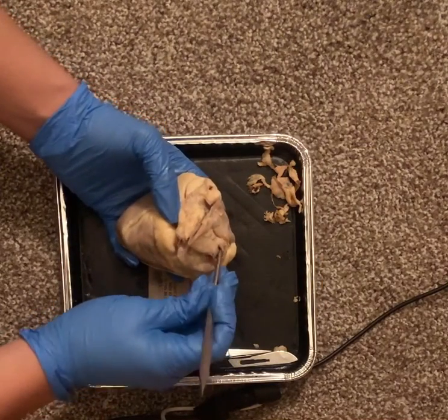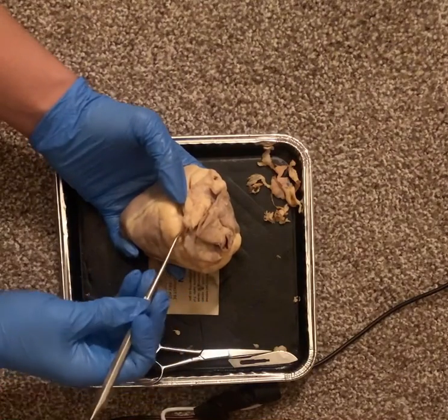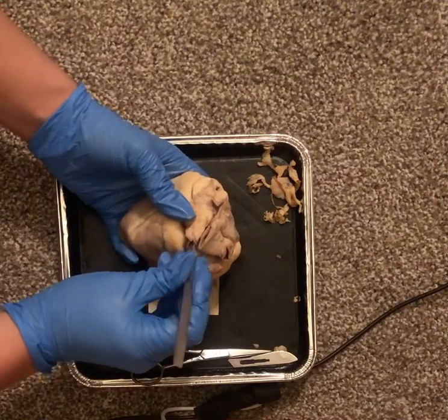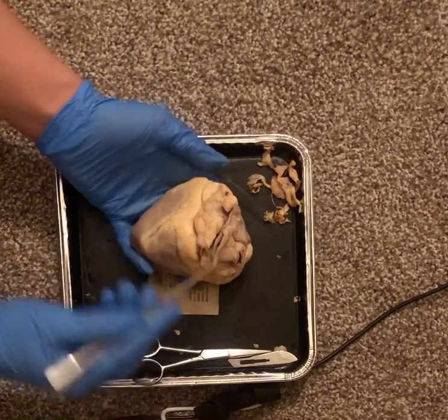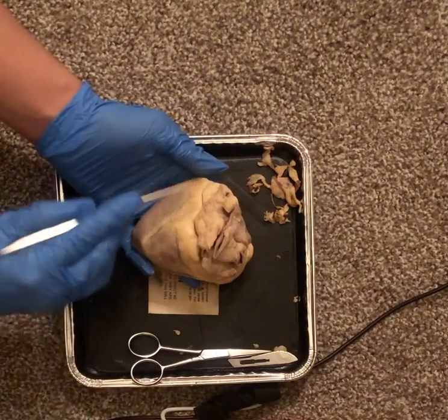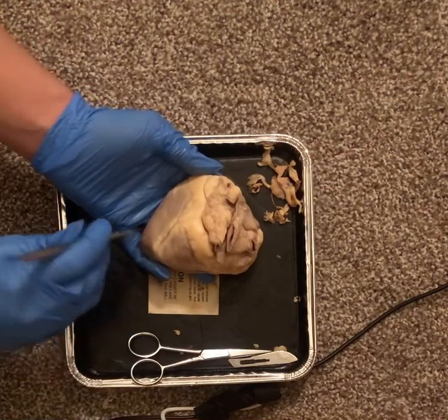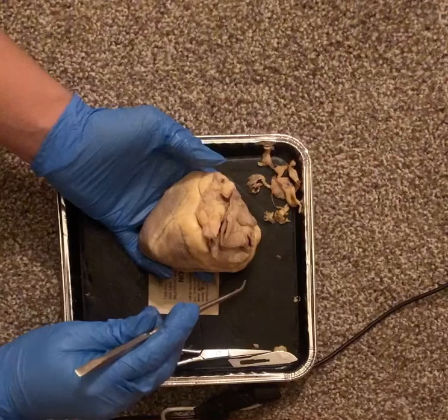Not only does this lead down, but it carries blood away from the heart and then is carried back through the pulmonary vein with the returning blood. Now here we have the base, which is where all the vessels enter and exit the heart, and here we have the apex, which is the end of the heart and a muscle of the left ventricle.